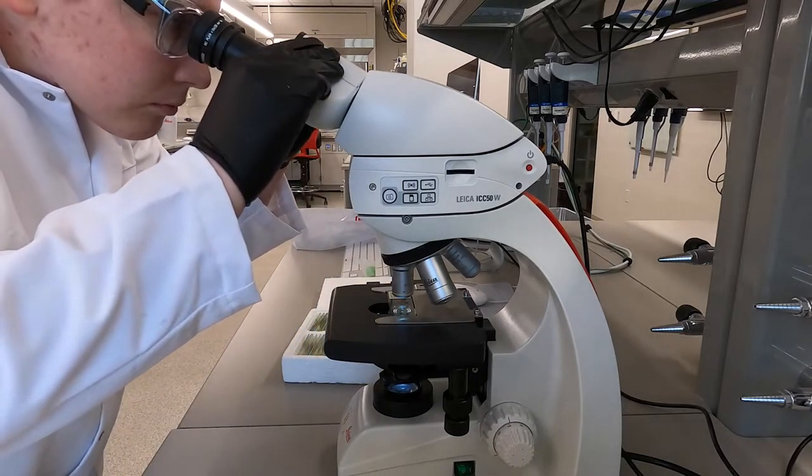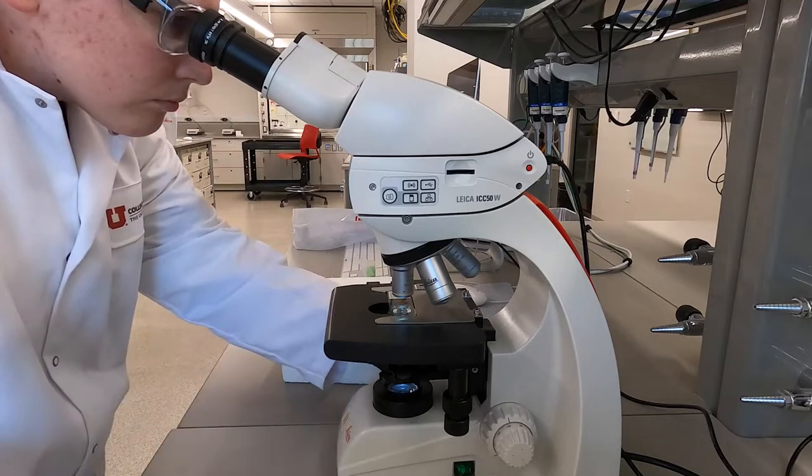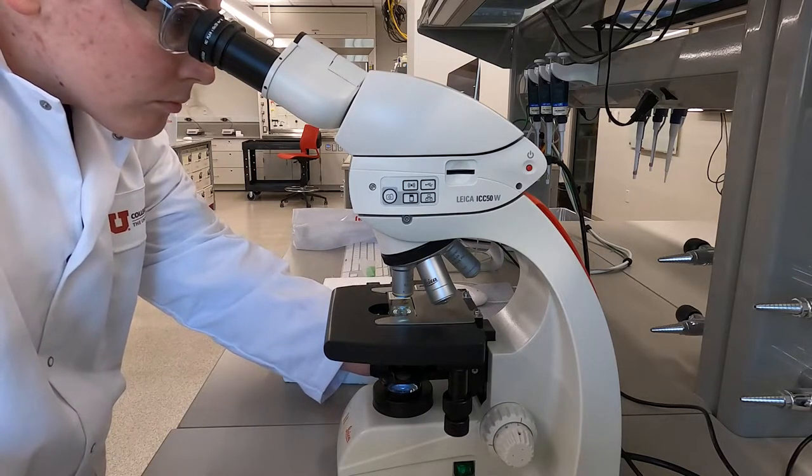Then, while looking at the sample through the eyepiece, slowly lower the stage with the coarse focus knob until you can clearly see the sample.